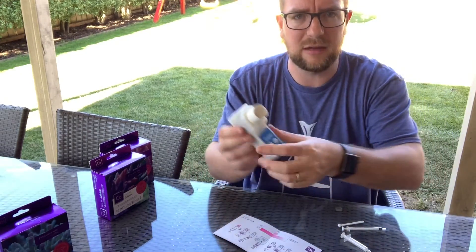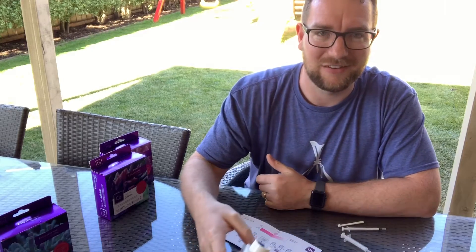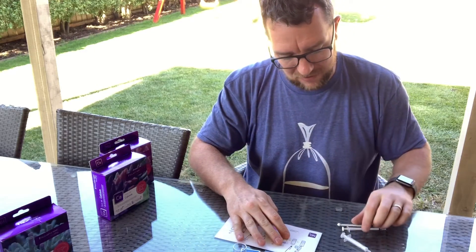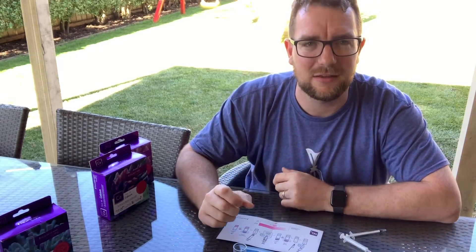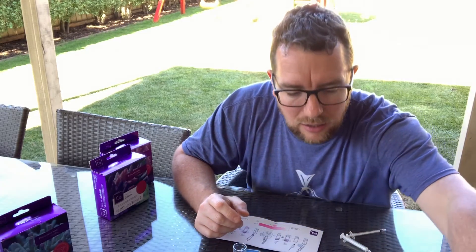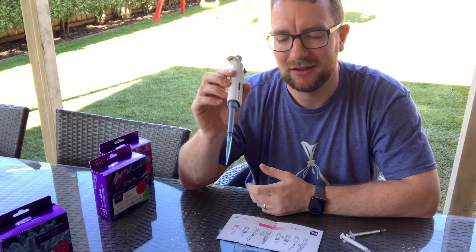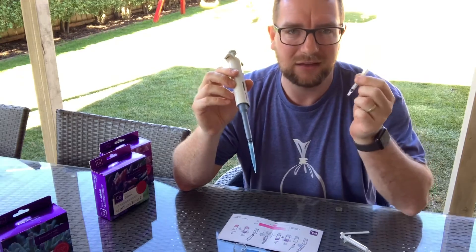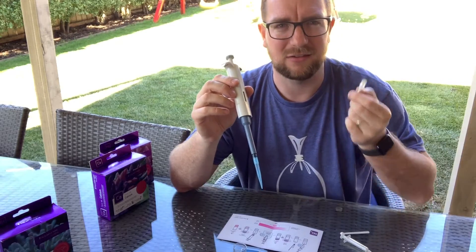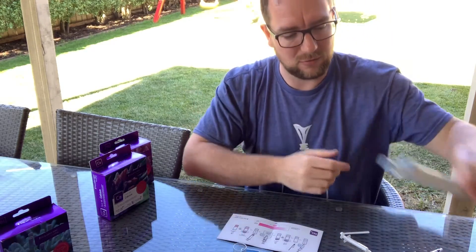For testing today I'll be using my Taylor speed stir because it makes stirring really easy — and as you can tell, I'm pretty lazy. This test kit uses one milliliter of tank water, which makes me a little nervous since the smaller the sample volume, the higher the margin for error. I like to use my adjustable pipettes to get exactly the right amount. As long as you're consistent with your mark on the syringe, you'll be fine.